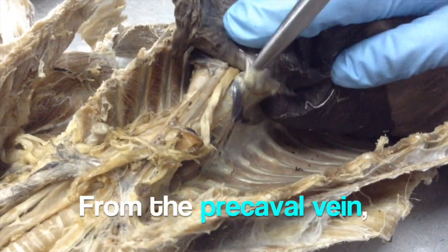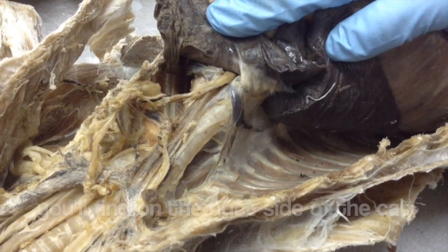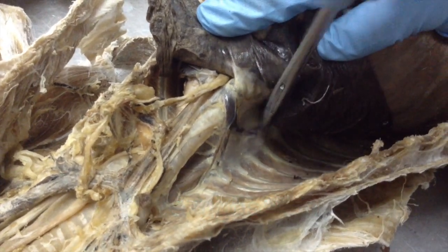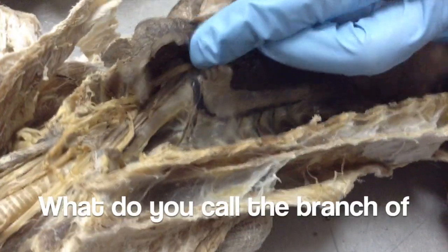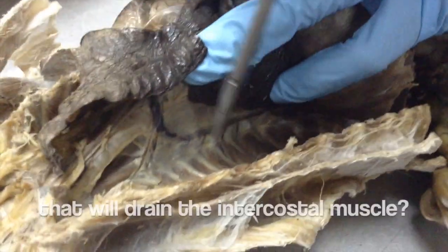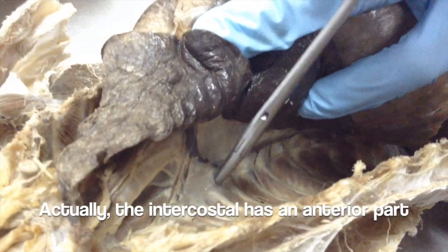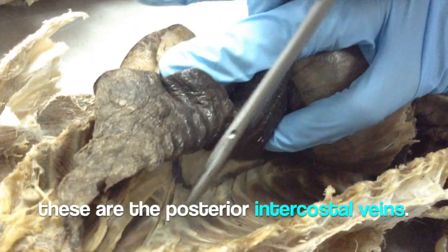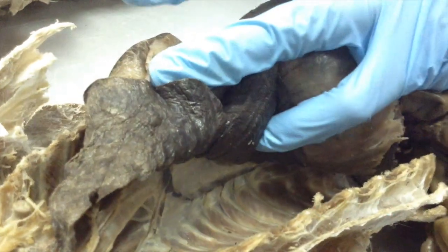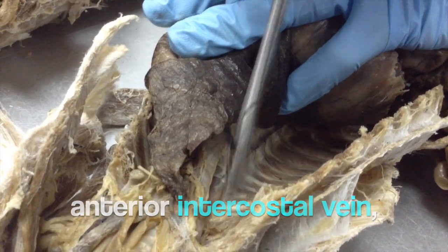From the pre-cava vein, you can find it on the right side. The branches of the vein include the intercostal vein, which you can see here.